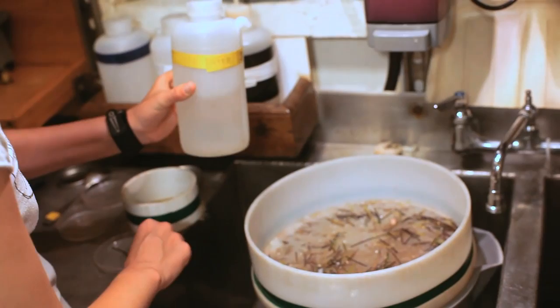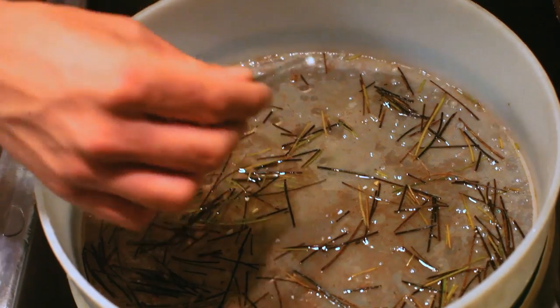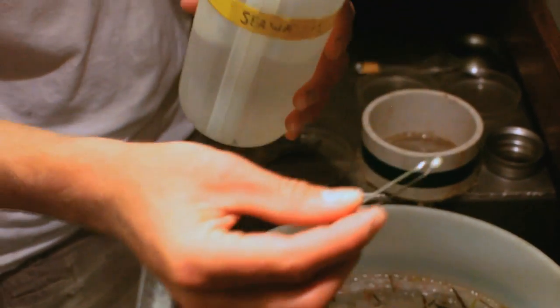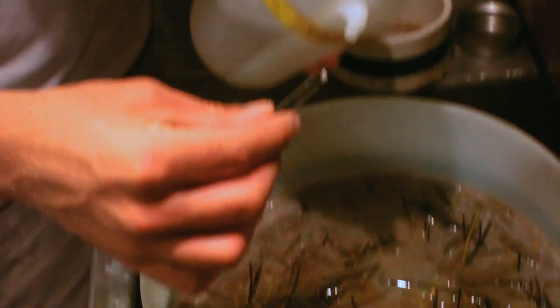We want to quantify the plastic later. So just take a couple pieces — just rinse it all down. We got one. First one. And let's get a lot on this side. One more piece.